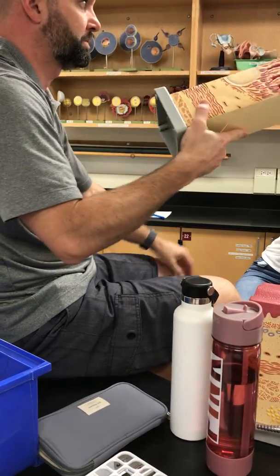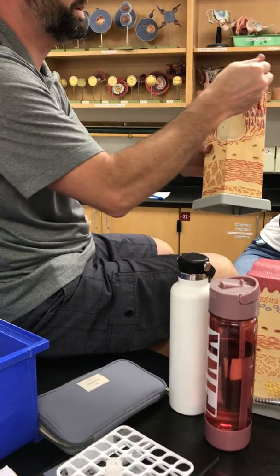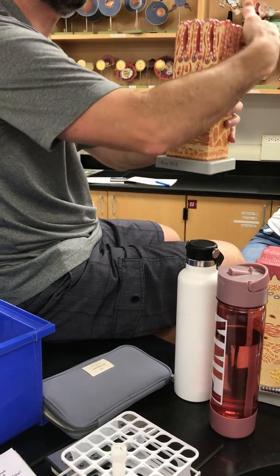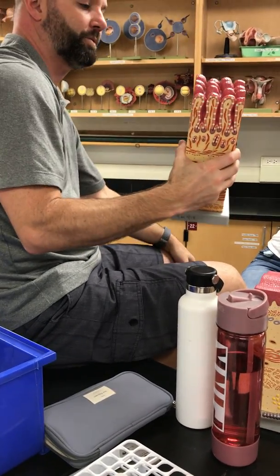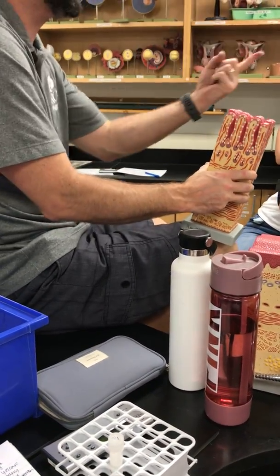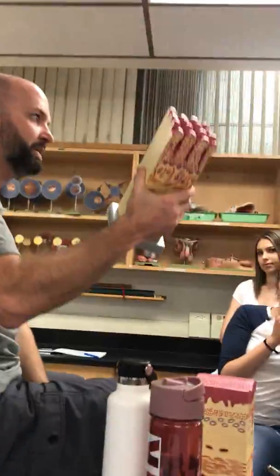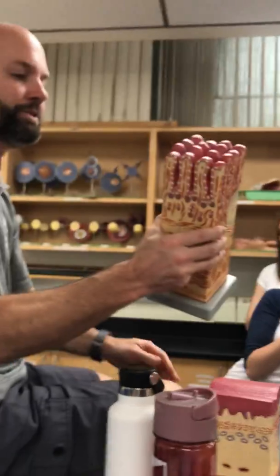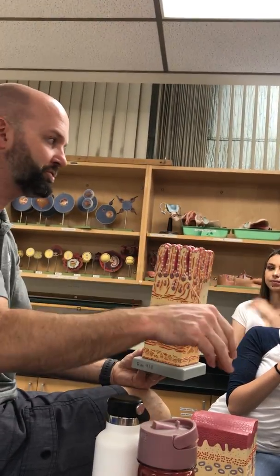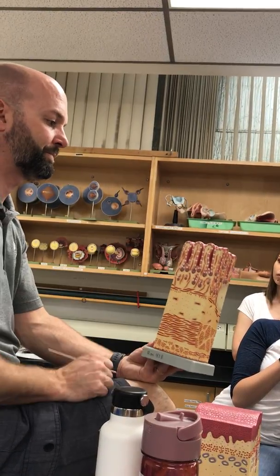So these structures. Microvilli. Or the villi. Just regular villi, yeah. And then the type of epithelium. Simple columnar again, right? Everything's simple columnar or stratified squamous. So the presence of villi excludes esophagus, stomach, large intestine. It can only be small intestine. You need to figure out if it's duodenum or jejunal-ileum. Because we don't have one for jejunum and one for ileum, so we'll just combine the two, jejunal-ileum or duodenum.